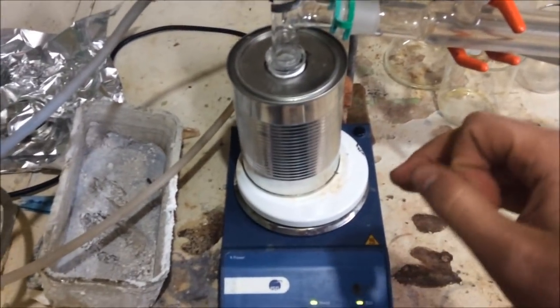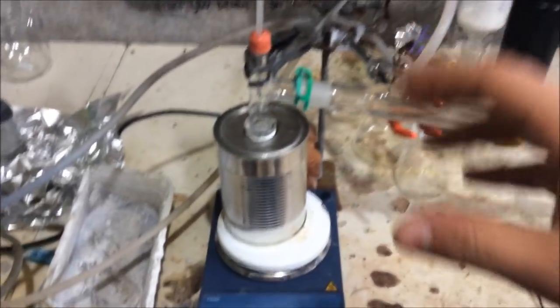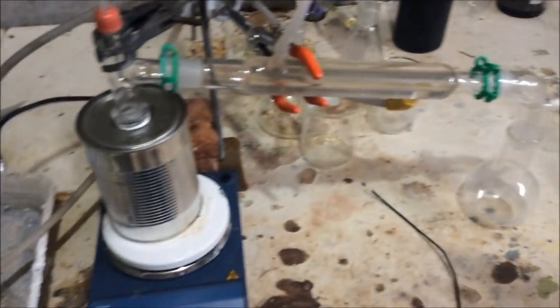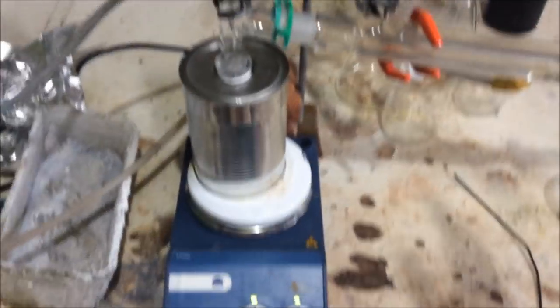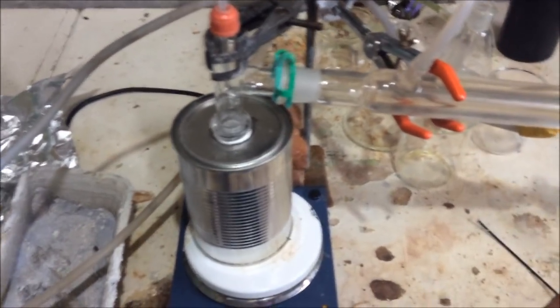I can't really see the sodium hydroxide melting while there's still ethylene glycol in there, but that might happen. So we might end up with some benzene in our ethylene glycol, which will suck. I can wash it out, re-distill everything and so on, but we'll end up with loss of yields and it'll be a lot more messy.